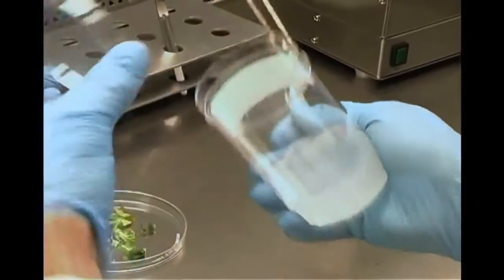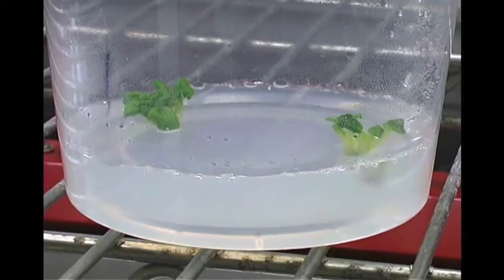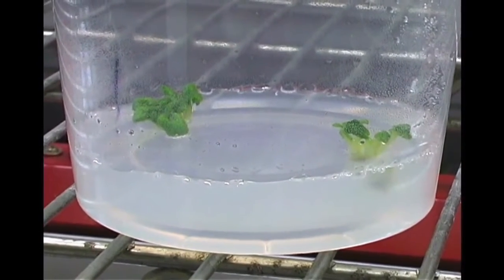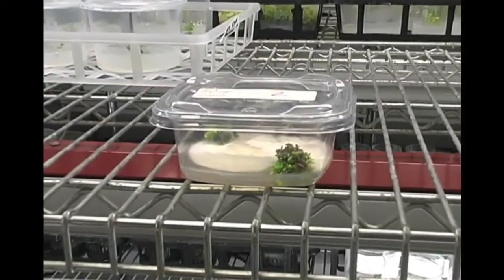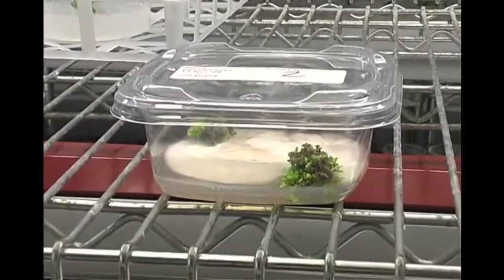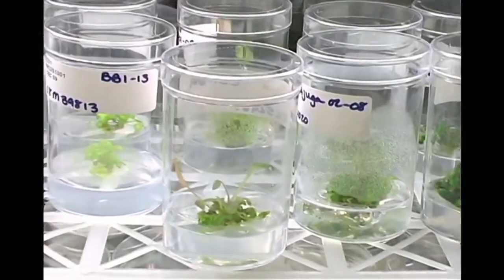In plant tissue culture, small pieces of plant tissue are placed on or in a medium rich in nutrients and sugar. If bacteria or fungi come in contact with the plant tissue or the medium, the culture becomes contaminated. The contaminants, bacteria and fungi, will use nutrients from the medium and quickly multiply and overwhelm the culture. Pathogenic contaminants will also destroy the plant tissue.